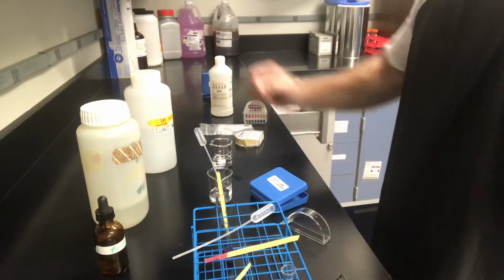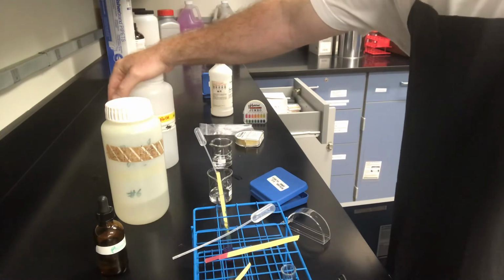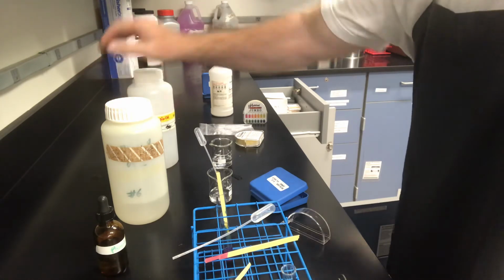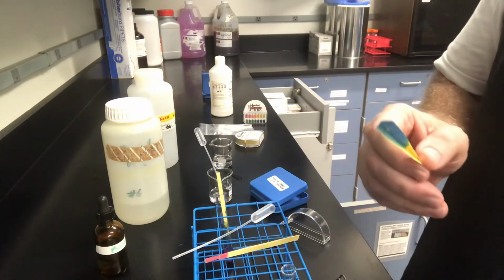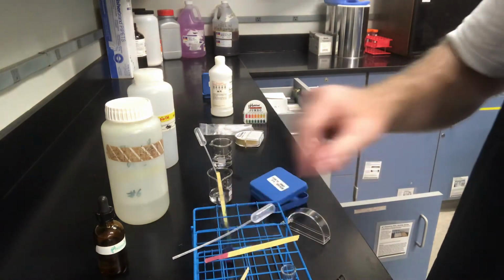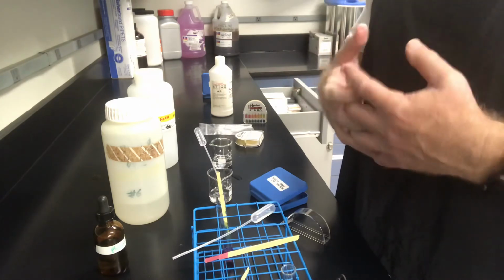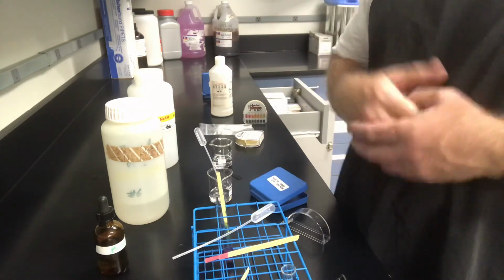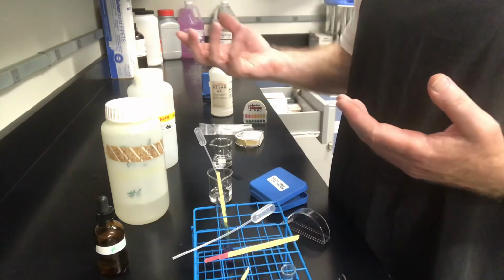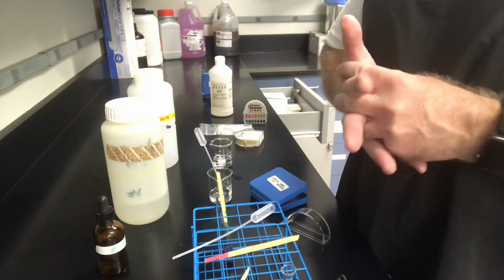So it's a little weaker than 1, which if you think about it makes some sense. This is twice as concentrated as this, and so a strong acid and a strong base should neutralize each other. What we did is we ended up with a pH well above, because once I added that extra drop of NaOH, it only takes 1 extra drop to skyrocket the pH and get that nice blue color. So it's not neutral because I didn't have equal amounts. But 25 drops is a little bit more than I would expect. You typically expect a 2-to-1 ratio in concentration, so you expect a 2-to-1 ratio in drops. It would take twice as much of the weaker to neutralize the stronger. So I would be expecting somewhere around 20 to 22 or maybe 23 drops.